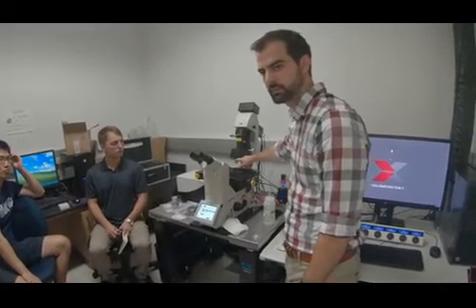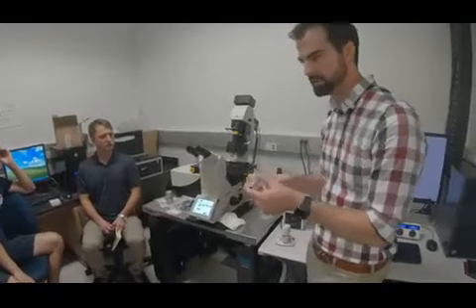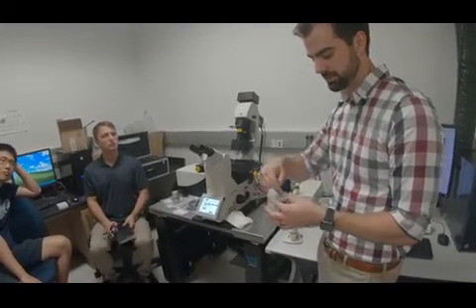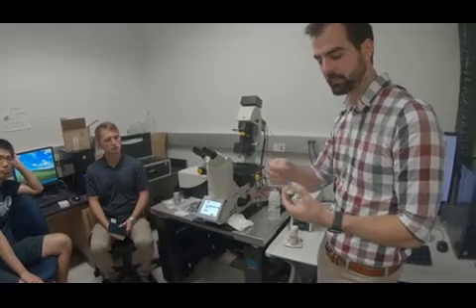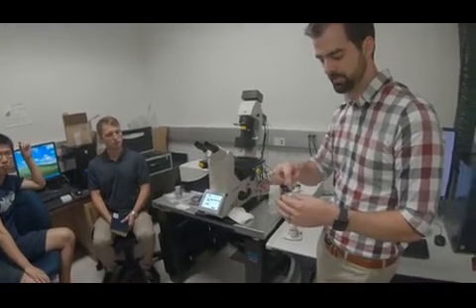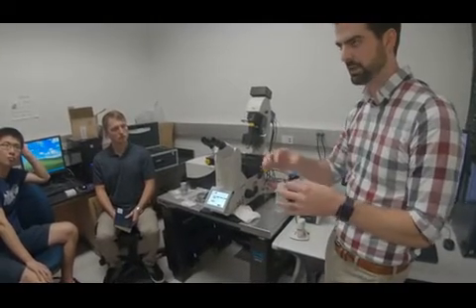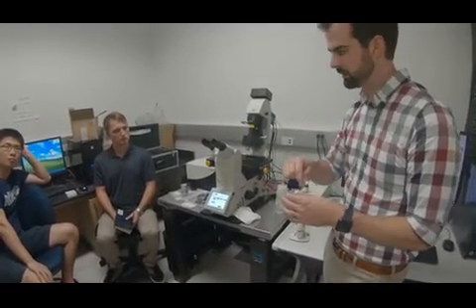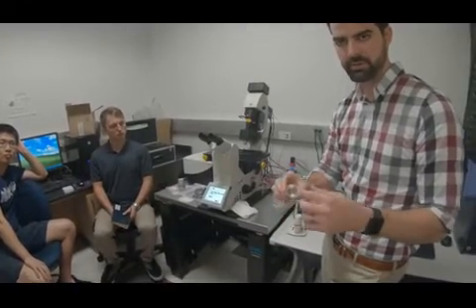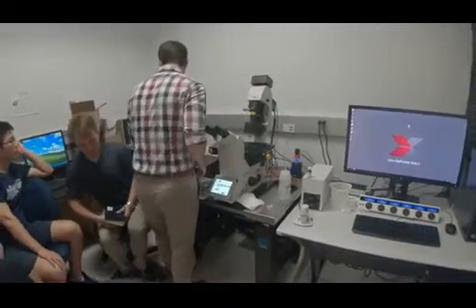Yes. The way it works is your sample is going to be in something like a 35 millimeter dish, and the sample has to be arrayed in a line. You can flood the whole chamber with agarose, put a sample in the middle, and embed the whole thing in agarose. So you have an agarose pancake with a sample in the middle, and you can cut away the agarose to form this shape.